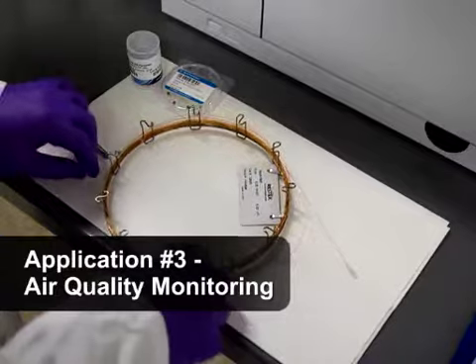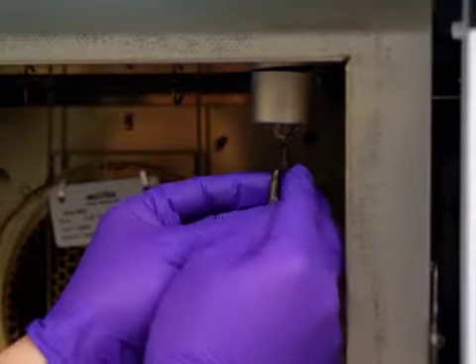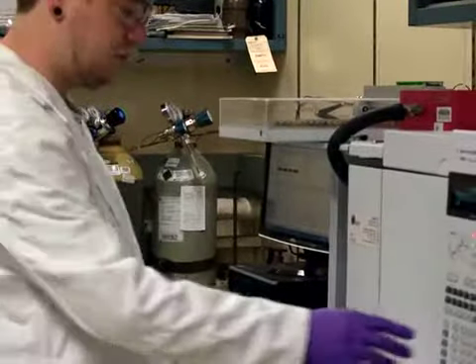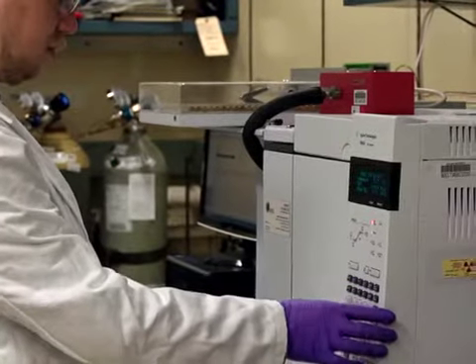GC is routinely used in air monitoring to detect volatile organic compounds, or VOCs, which may arise from environmental pollution, pesticides, and explosives. GC can be used to track and identify VOCs both indoors for headspace analysis and outdoors for health, safety, and security.